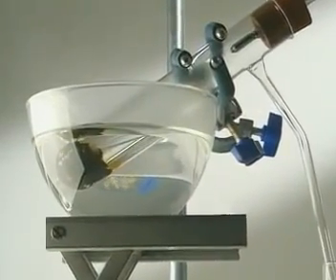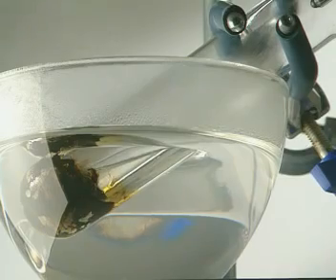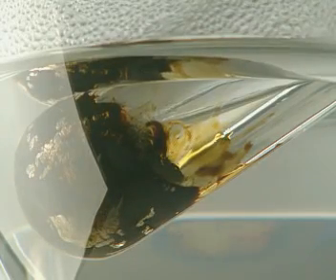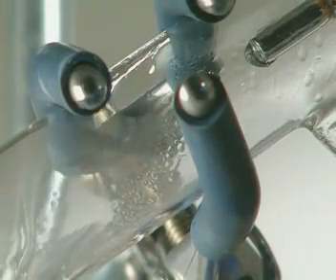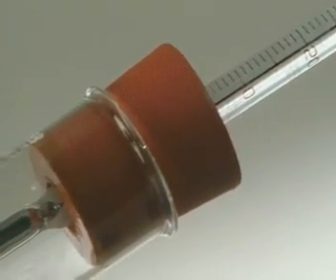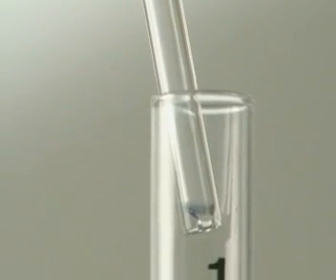The hydrocarbons with lower boiling points begin to vaporise immediately. They're flammable, so it's safer not to heat with a naked flame. As the vapour rises, it enters the sidearm, where it cools and condenses. This happens at about 40 Celsius. The hydrocarbons which boil at this temperature drip down the sidearm and form our first fraction. It's a colourless liquid.